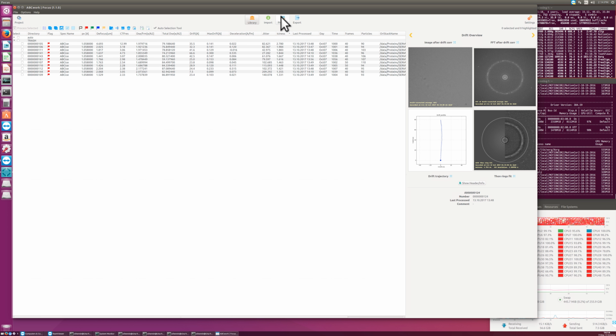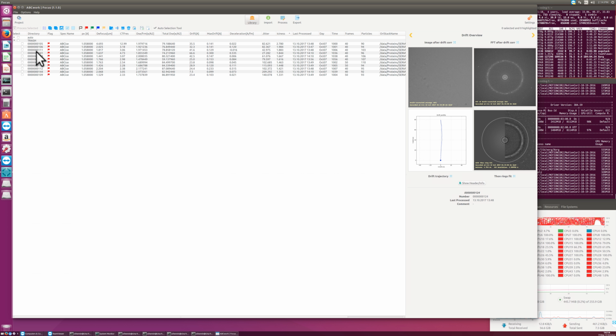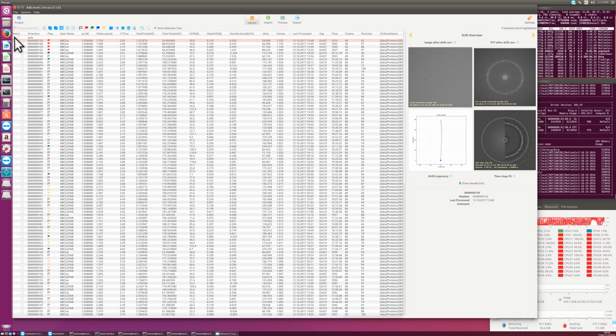This may cause a problem for the batch processing queue if an image is still processed or is still in the queue while you move the entire folder for that image to a different location. Then the processing queue will crash at this image, the scripts or so. But if you are sure that it's trash, then you could also move it there.